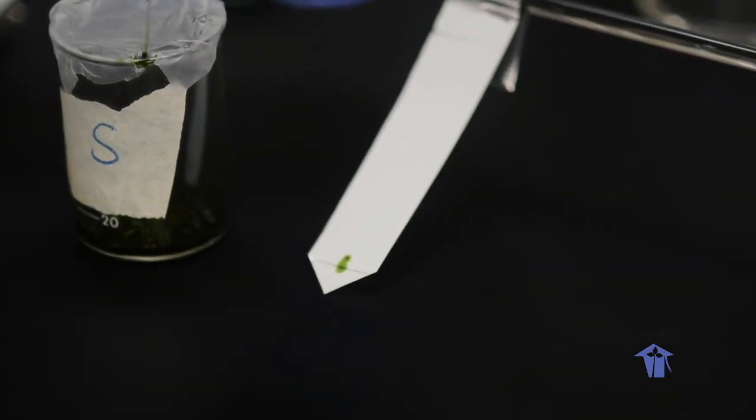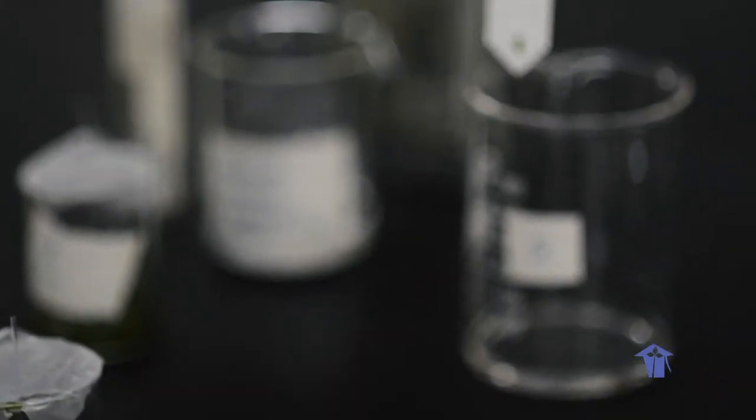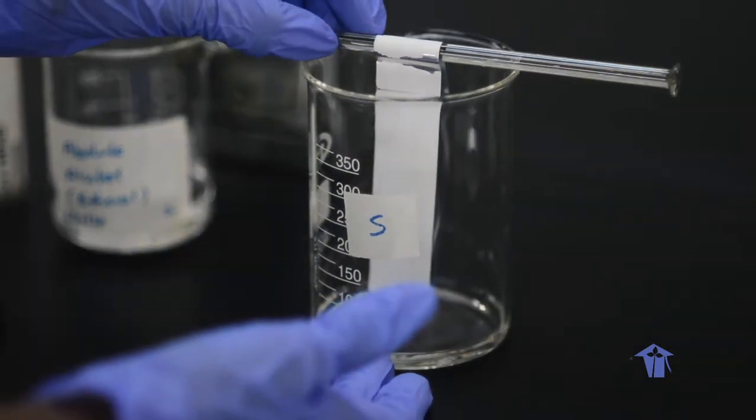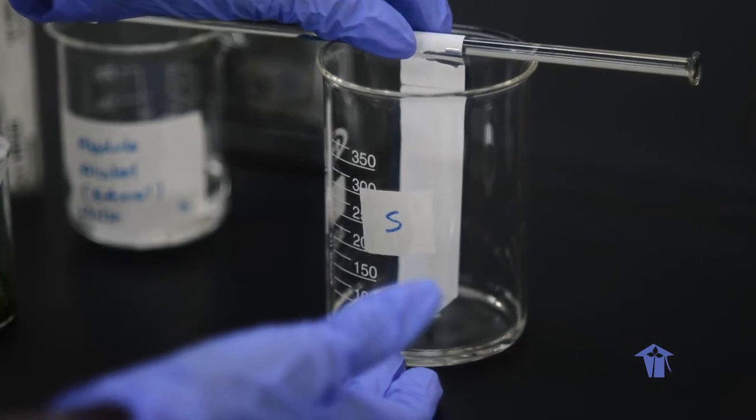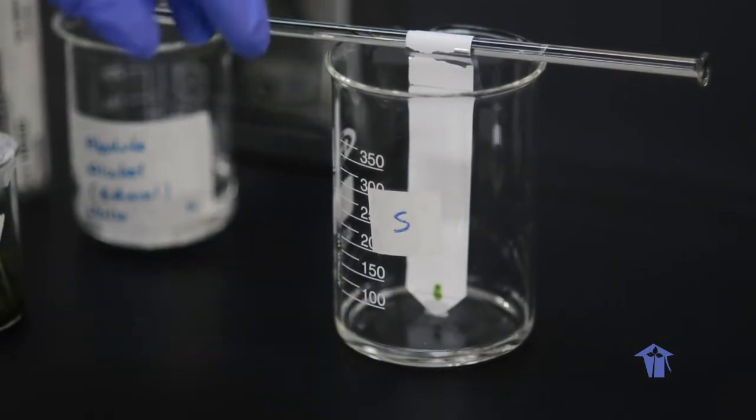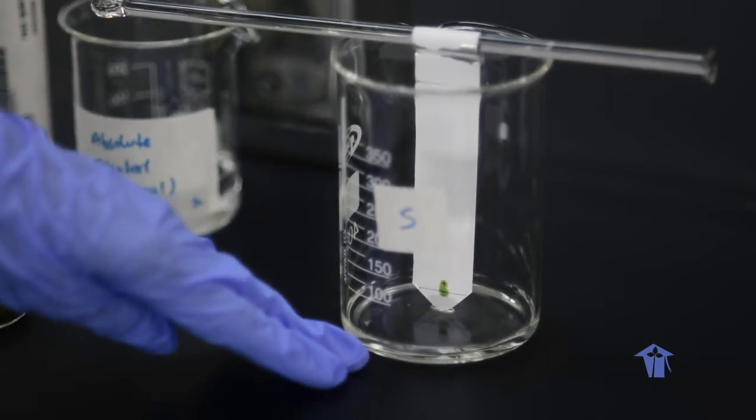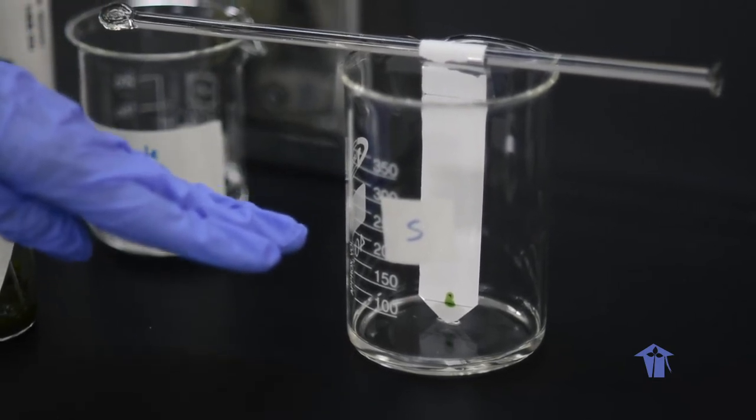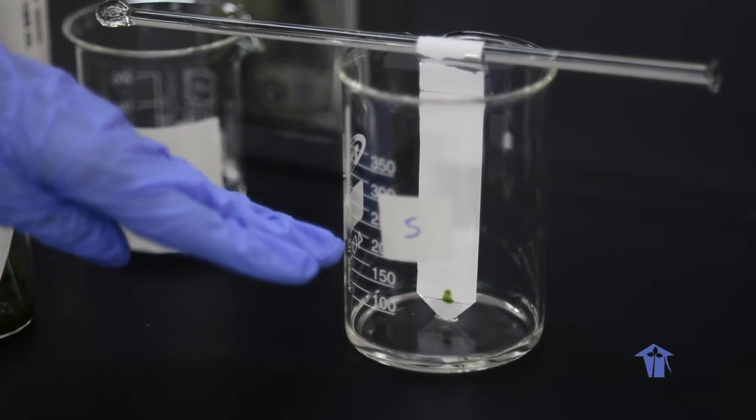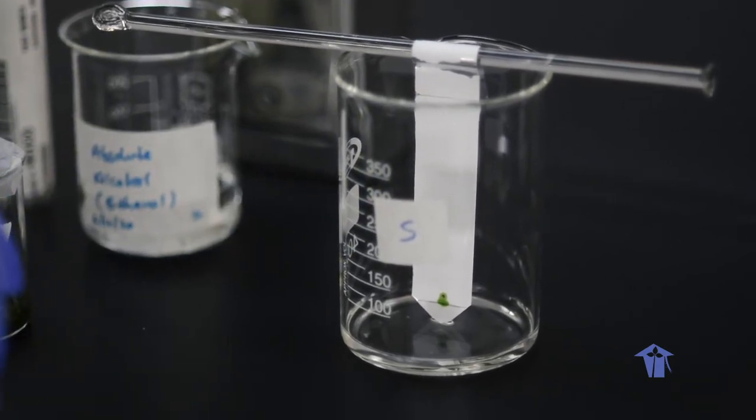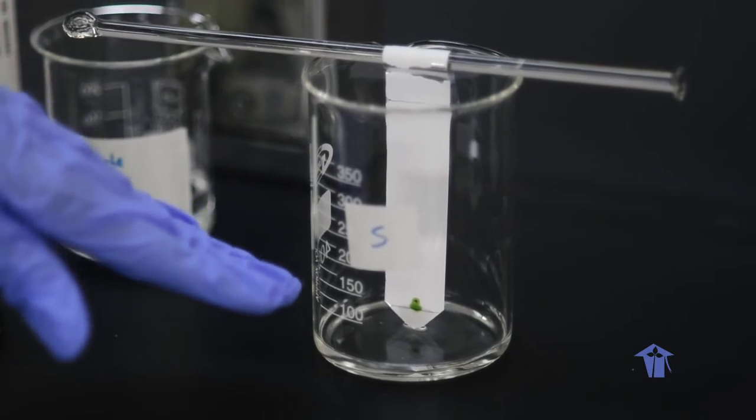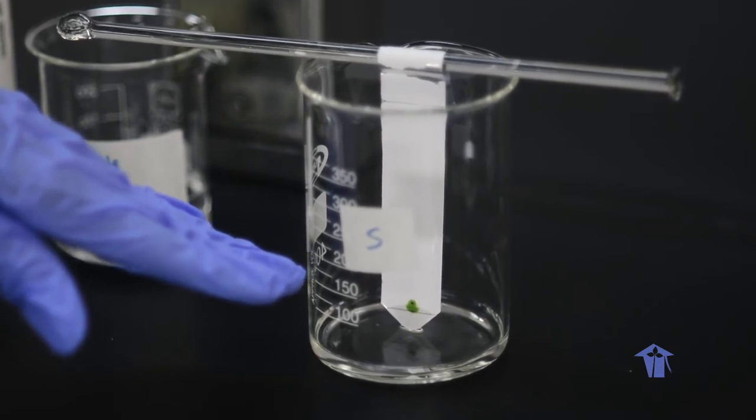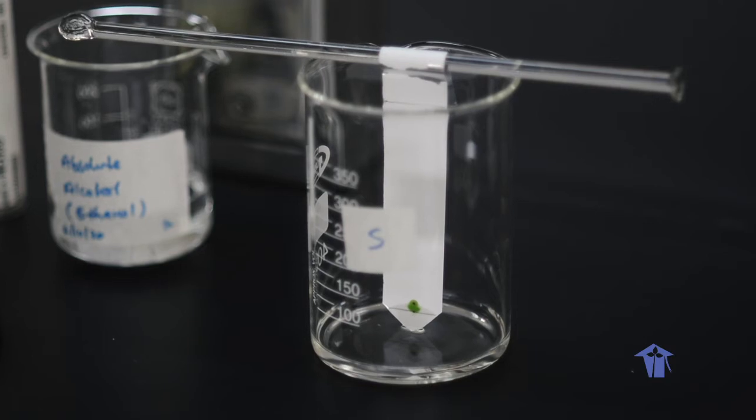I'm going to hang the paper into the solvent. The solvent is alcohol. You'll notice that the tip of my chromatography paper has fallen within the solvent, and the solvent is going to be moving up this chromatography paper by capillary action and causing the pigments that I have obtained from my spinach to dissolve. We're going to leave the setup for a little while to allow it to separate into the various components of the pigments that make the spinach leaves so dark green.